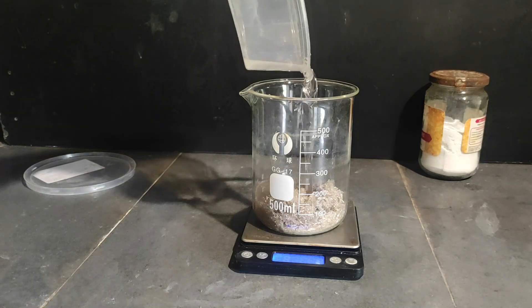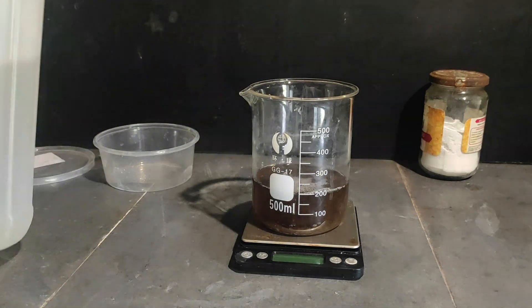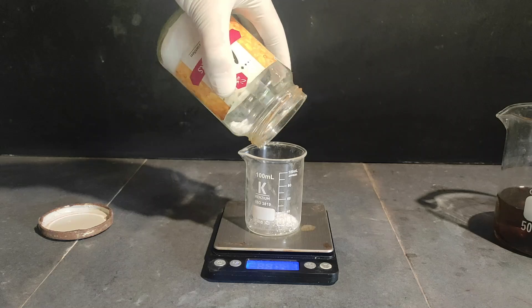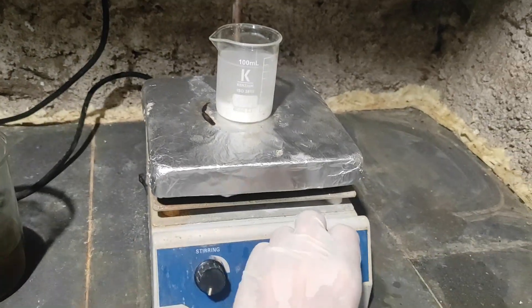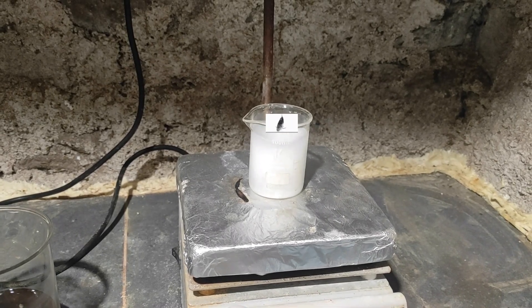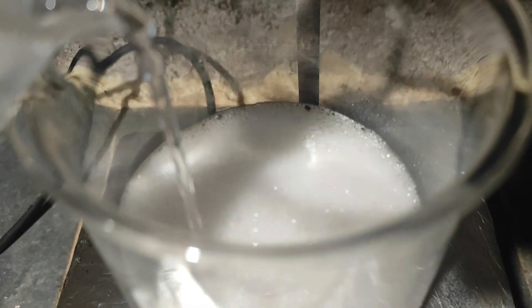Then I add some water until the 200ml mark. The solution is very dark, indicating lots of impurities, but it's actually fine because they seem to disappear somehow later. Then I made a solution of 22g of sodium carbonate in a 100ml beaker by stirring it on the hotplate. When it has finished dissolving, I add it to the para-toluenesulfonic acid in small increments.